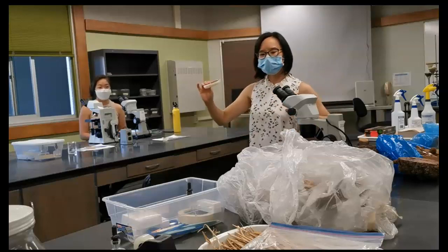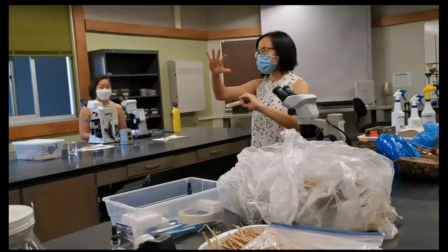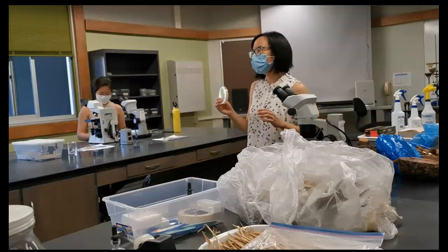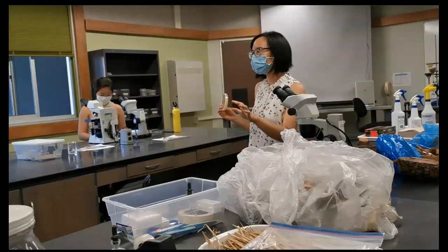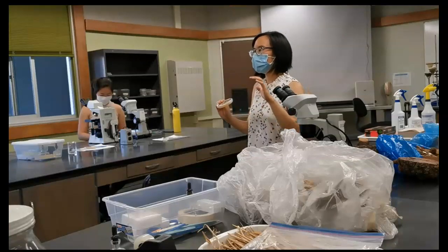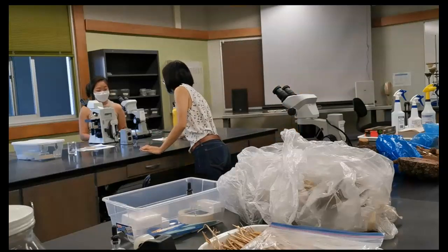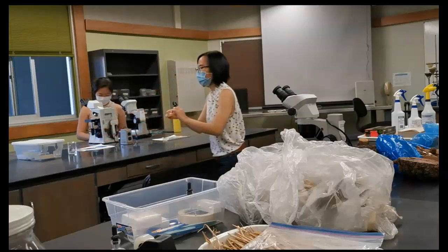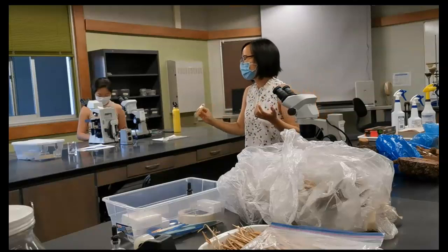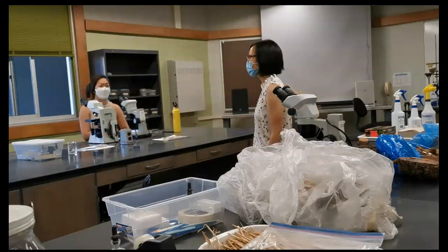So all the cells are growing together. You can't see colonies, but you see a pile of bacteria. But then at the end, when there are not so many bacterial cells, they separate, and then from each bacterial cell, a colony develops, so you can get single colony. There are some that are really good. My assistant did a very good job of getting single colonies, but some, the concentration of bacterial cells are so high that they're growing together.